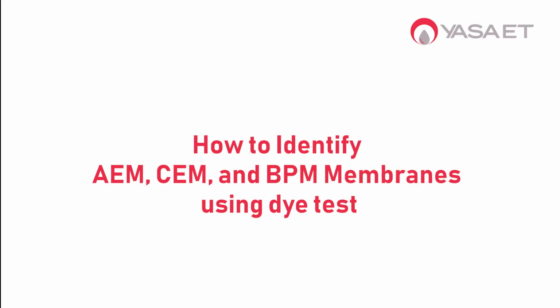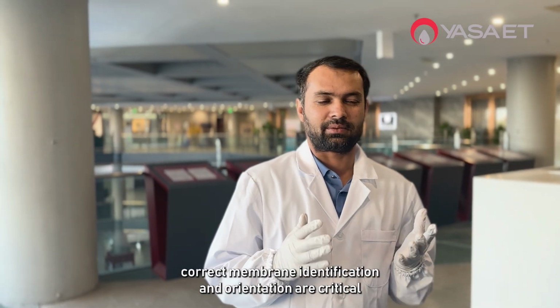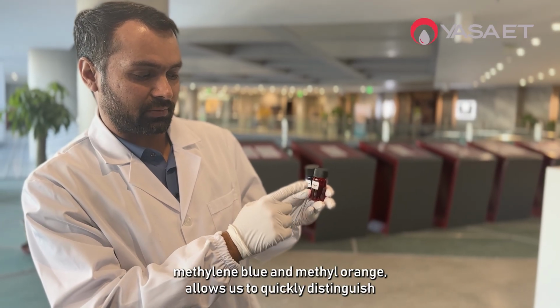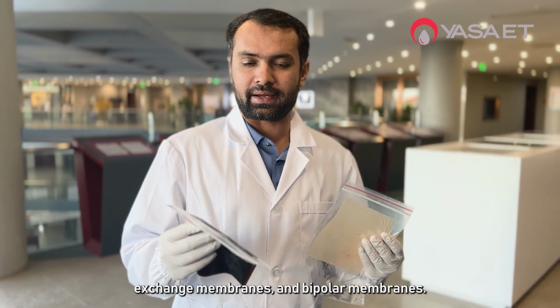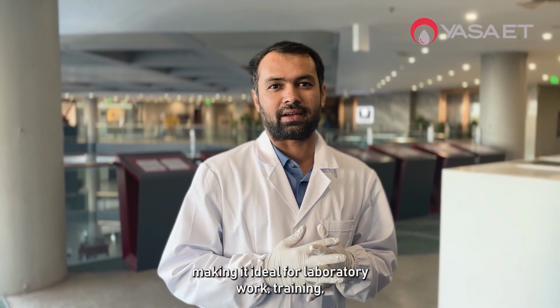How to identify AEM, CEM, and BPM membranes using dye tests. In electrodialysis and bipolar electrodialysis systems, correct membrane identification and orientation are critical for performance and reliability. A simple laboratory test using two common dyes, methylene blue and methyl orange, allows us to quickly distinguish between anion exchange membranes, cation exchange membranes, and bipolar membranes. This method is fast, low cost, and highly visual, making it ideal for laboratory work, training, and quality control.